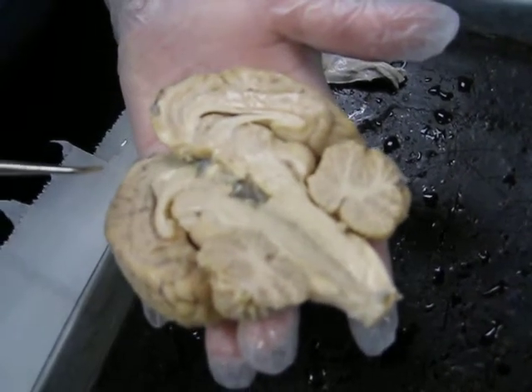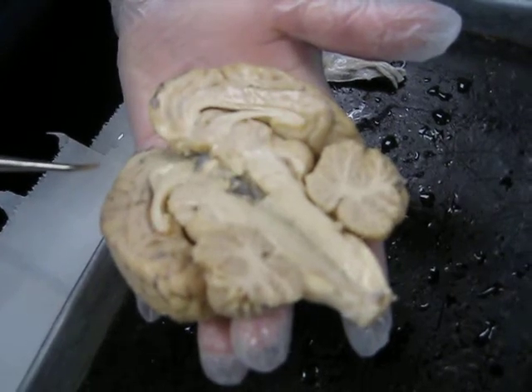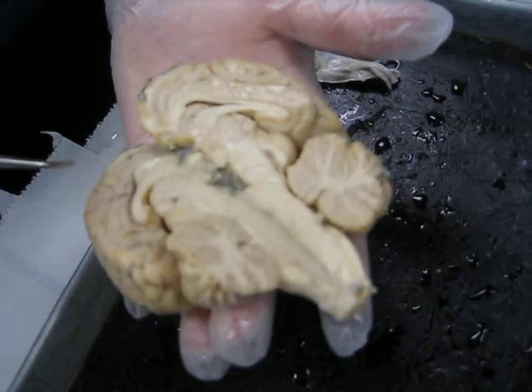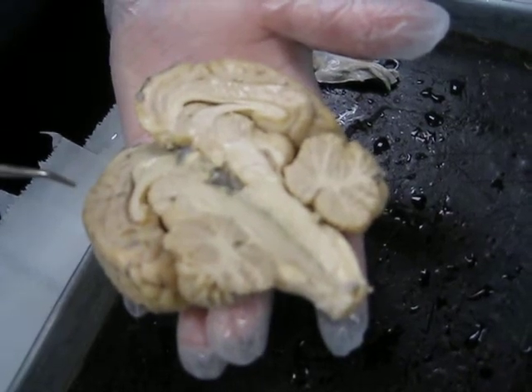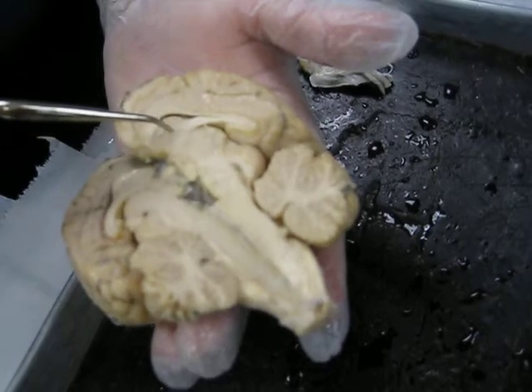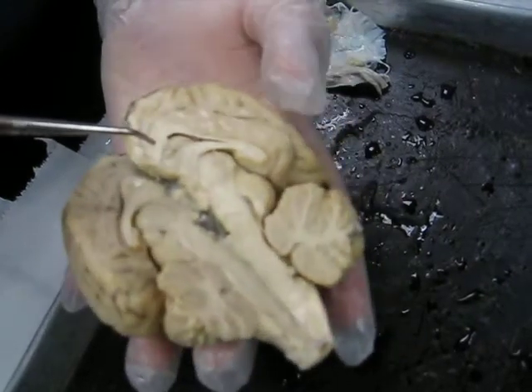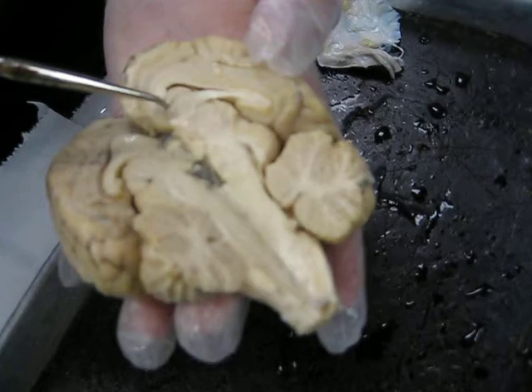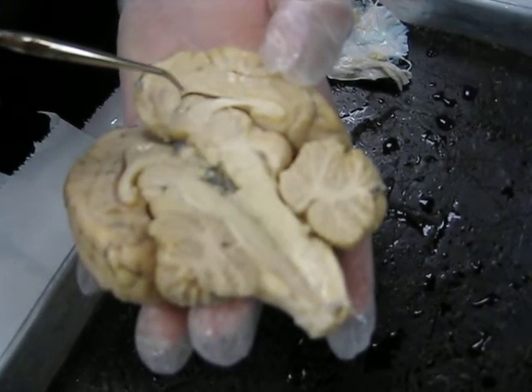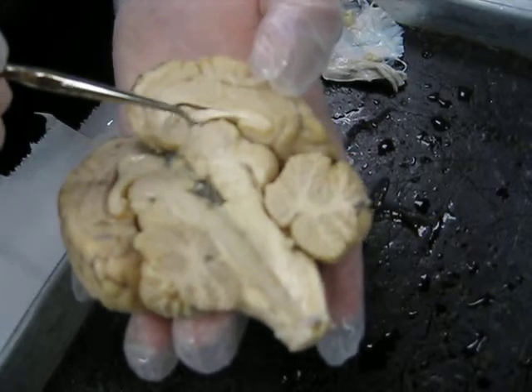Extending off from the back end of the corpus callosum and coming forward, a little tongue sort of. I'm going to open up the ventricle on the side so we can see where we're at. So it would have been nice if she stuck with the previous one. It was actually better. Lateral ventricle. You guys see your lateral ventricle? Under its membrane, that little space is your lateral ventricle. The little band above the lateral ventricle is the corpus callosum. And this little tiny one right here below the lateral ventricle, that's the fornix.